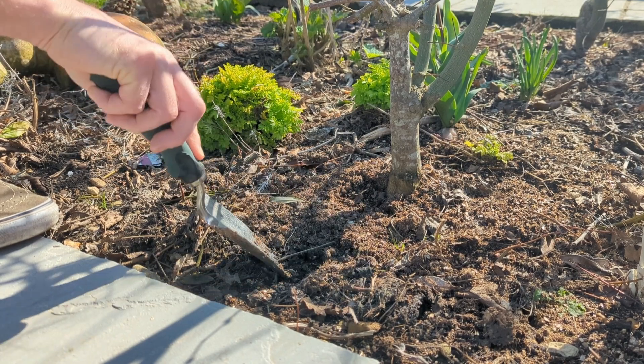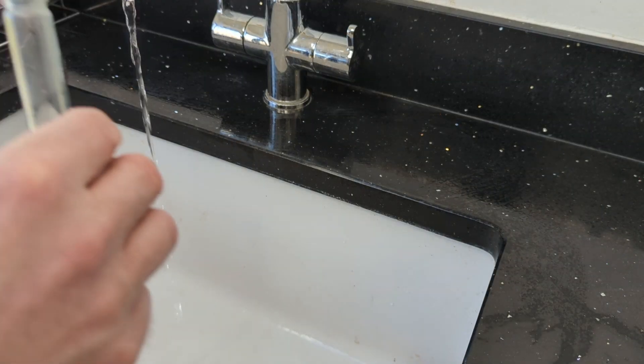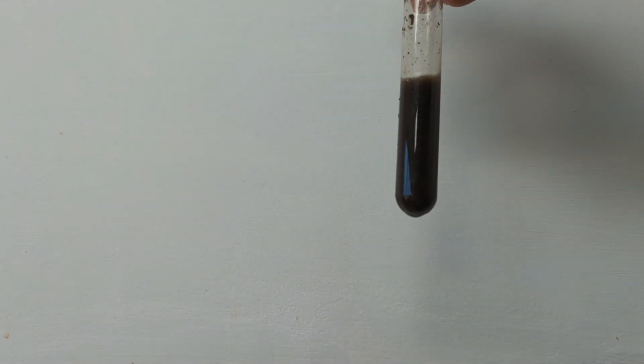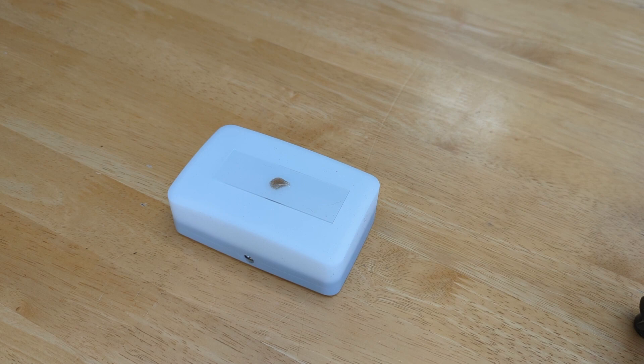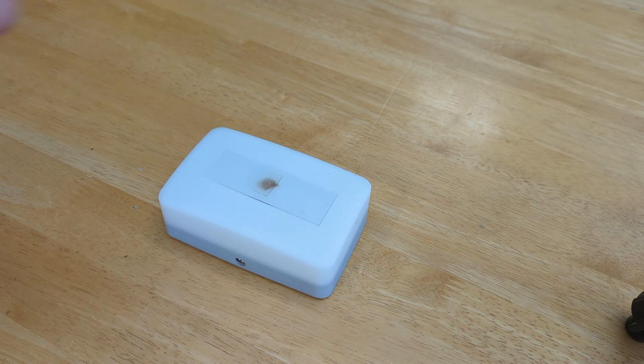Now was the time to have a look at a soil sample. I did my usual — I went out to my garden and collected a little bit of soil and put it in my test tube. I then put some water in it and gave it a really good shake to release all of those microbes into the water before pipetting it out onto a slide. I blobbed a bit onto the slide and put my cover slip over the top. I also need to mention that this kind of setup with the smartphone needs a light stage.